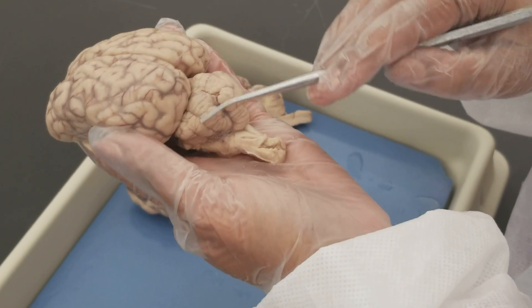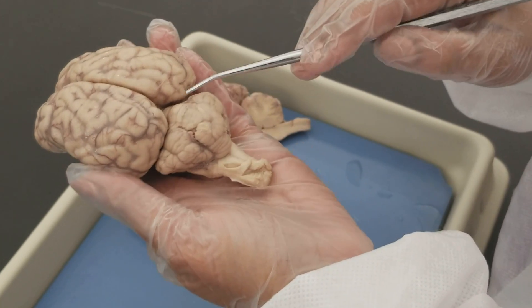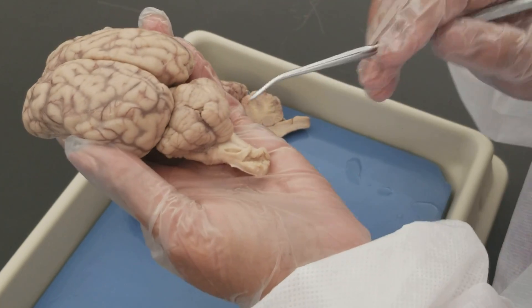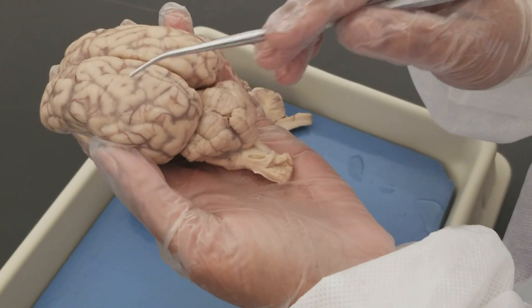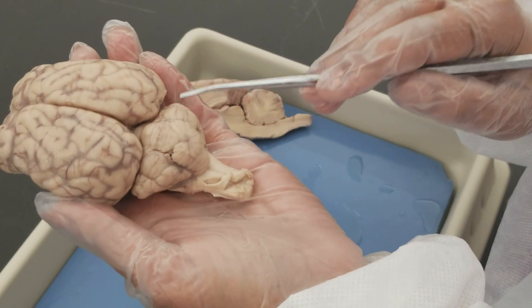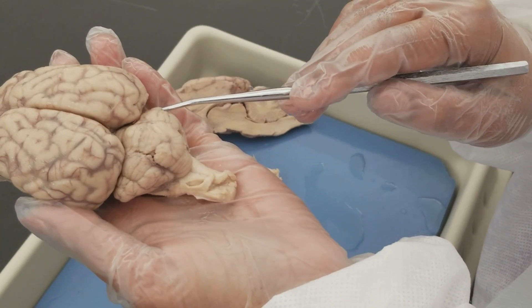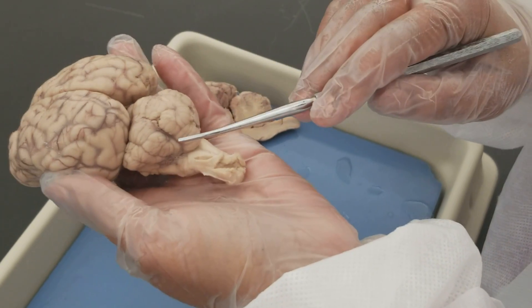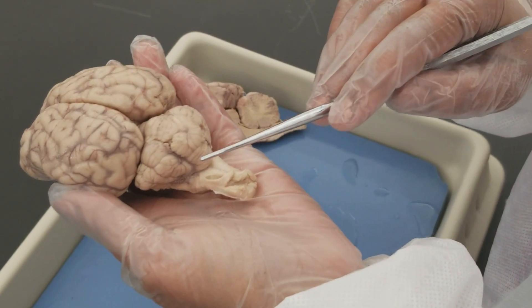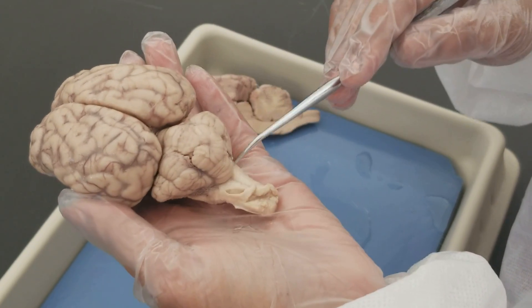Behind the cerebrum, this small region of the brain is called the cerebellum, or the small brain. The cerebellum, just like the cerebrum, has left and right halves, and these hemispheres are connected by a worm-like structure called the vermis.